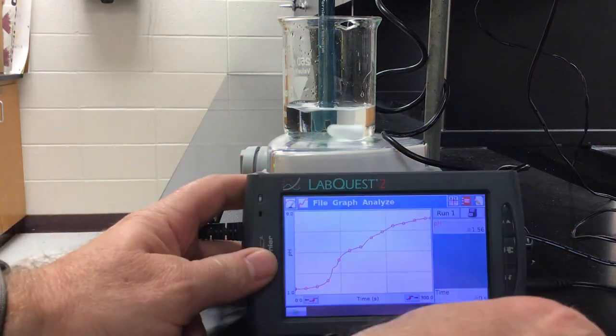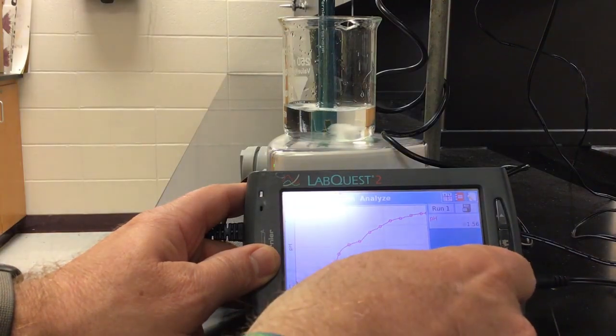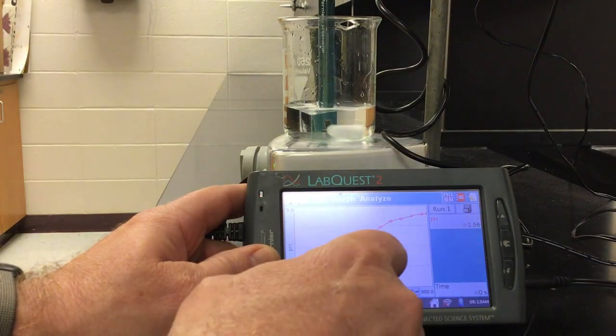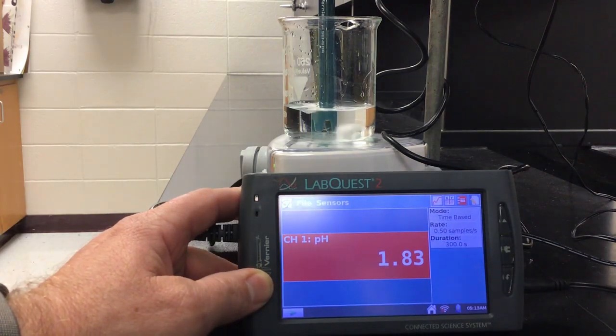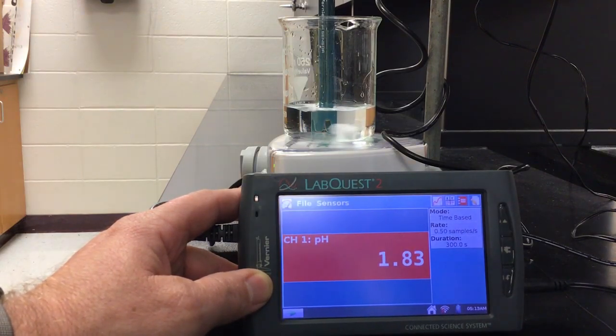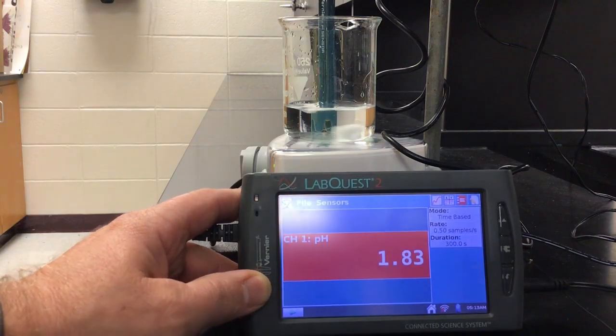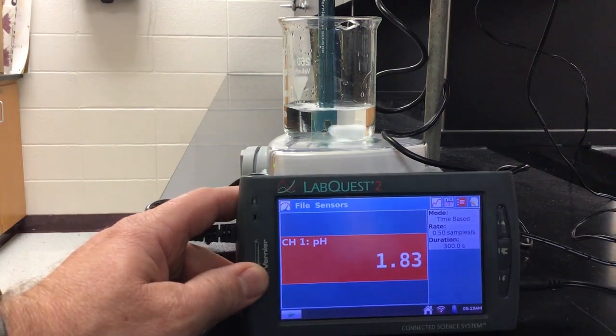What we should see happen, I'll just take the data again, is we're going to see that pH value go down. Let's go back and look here. So our pH value has now decreased from where it was at about 8 back down to 1.83. So think about what this point is, and then you're going to write what you think that point is in your data chart and answer the rest of the questions. And you'll have to choose which one of the weak acids you think this one is. Okay? Thanks.